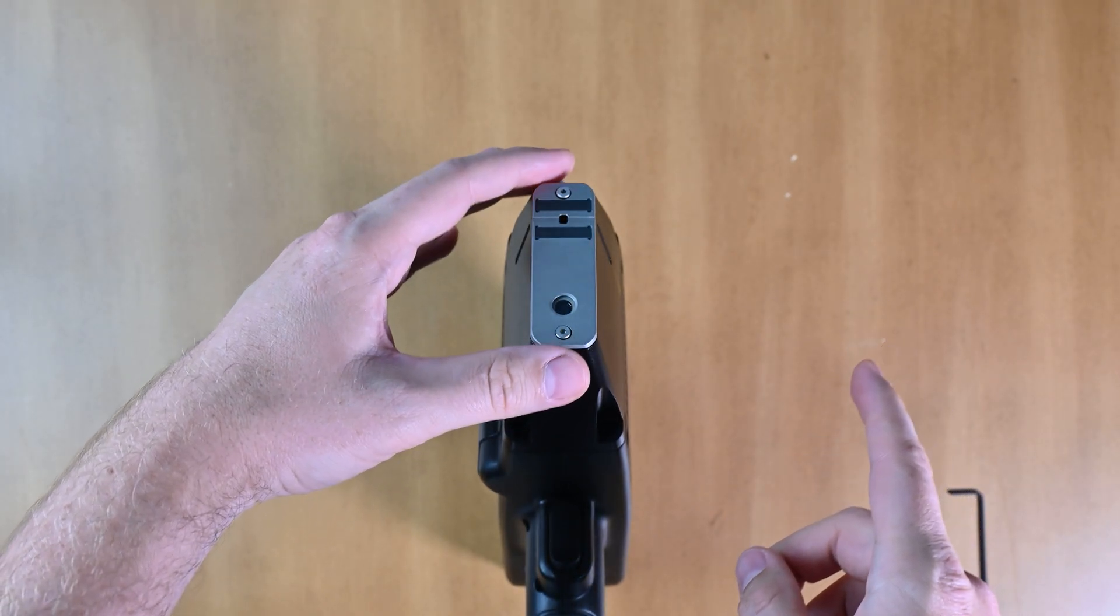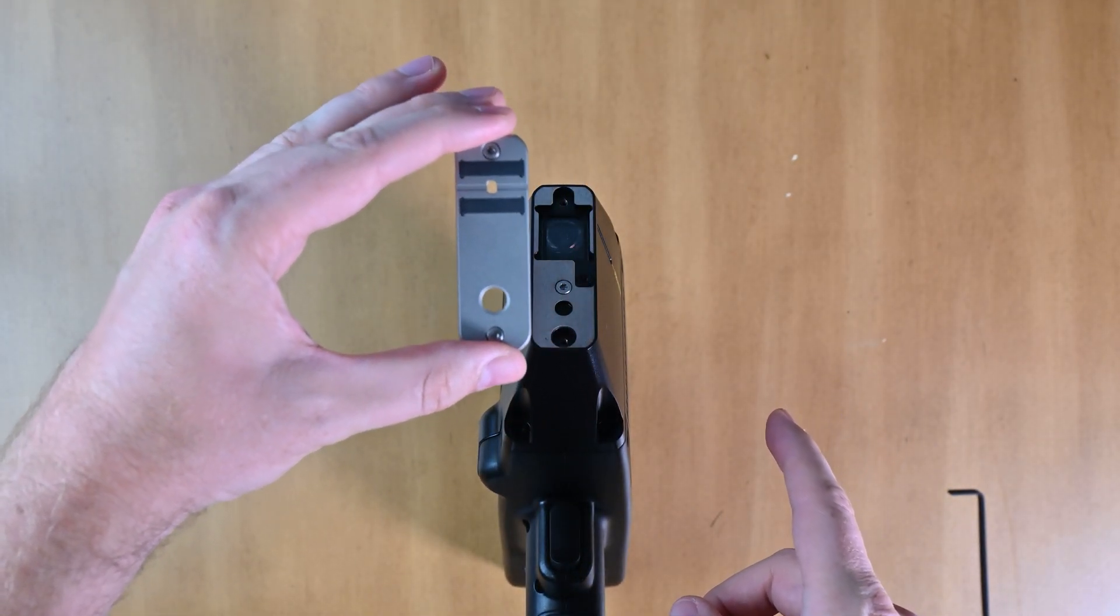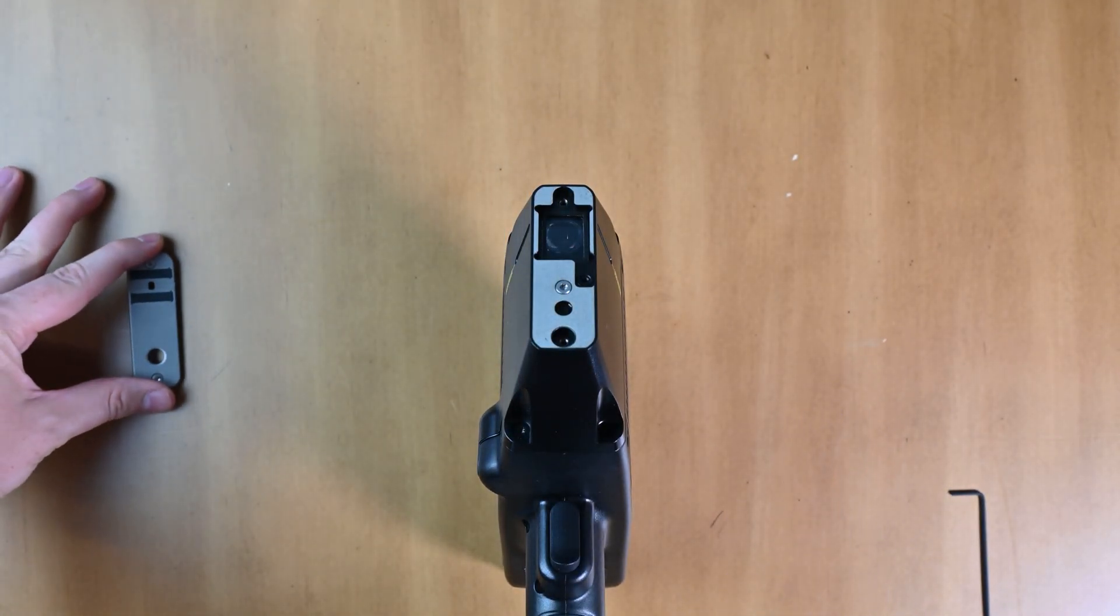Now that we've loosened the screws, the faceplate should come off really easily. And you need to set that someplace nice and clean.